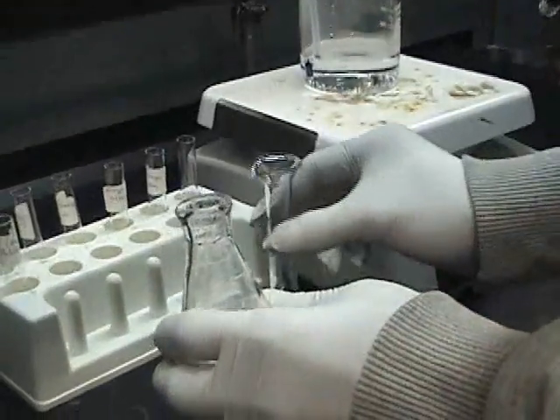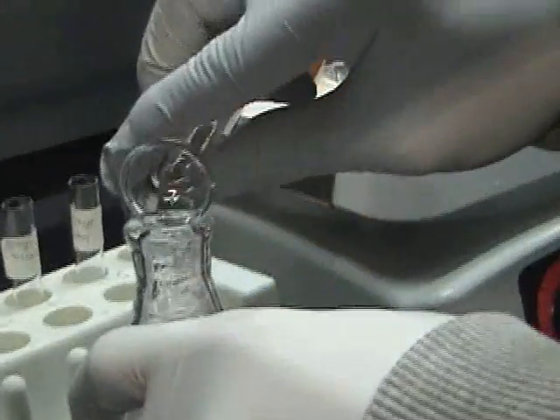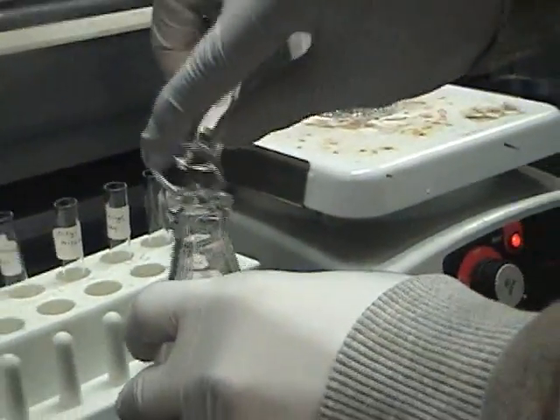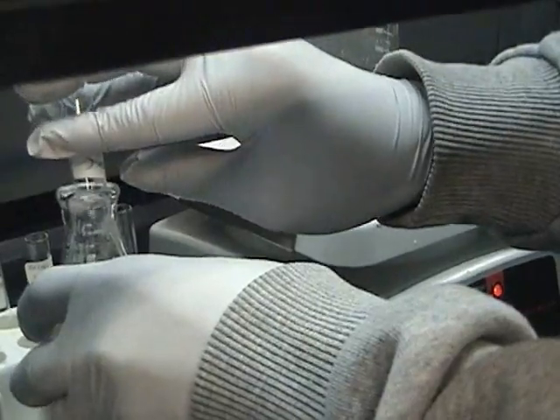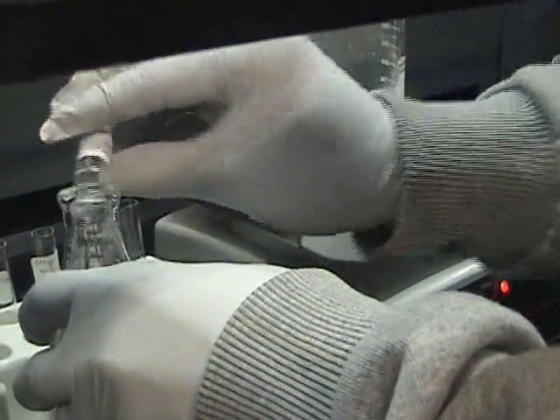Add 5 ml of fresh acetic anhydride, followed by 10 drops of concentrated sulfuric acid. Swirl the flask to mix thoroughly.